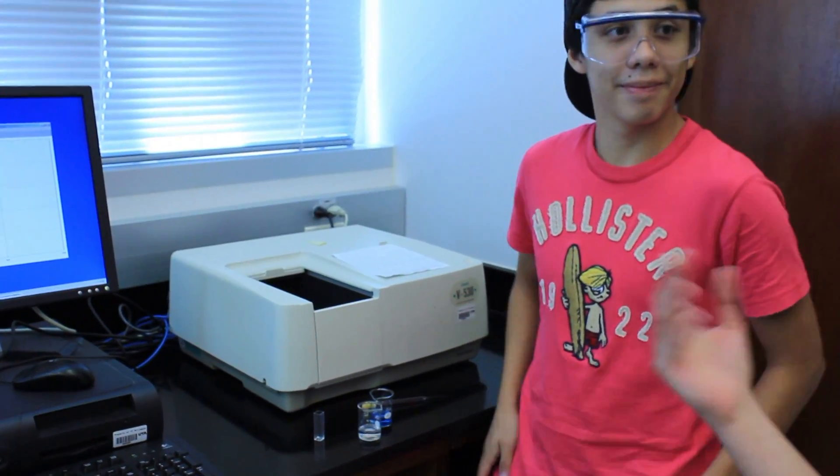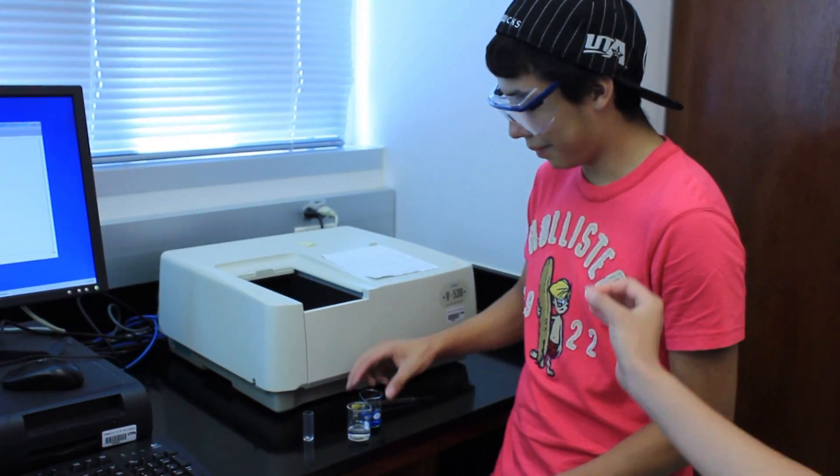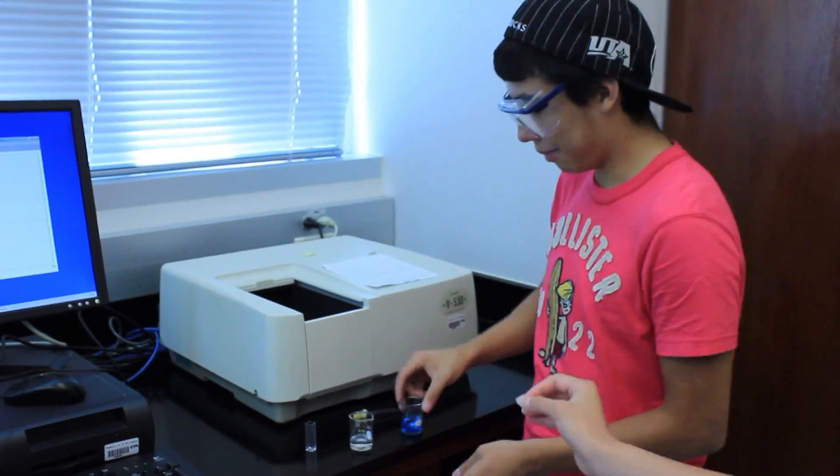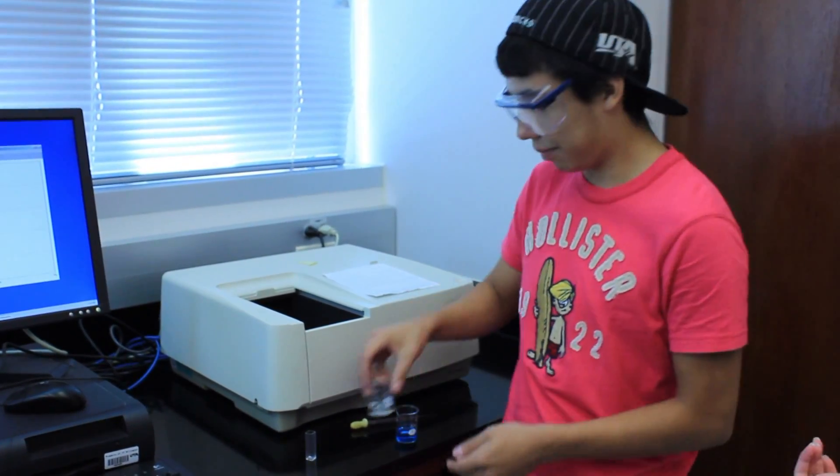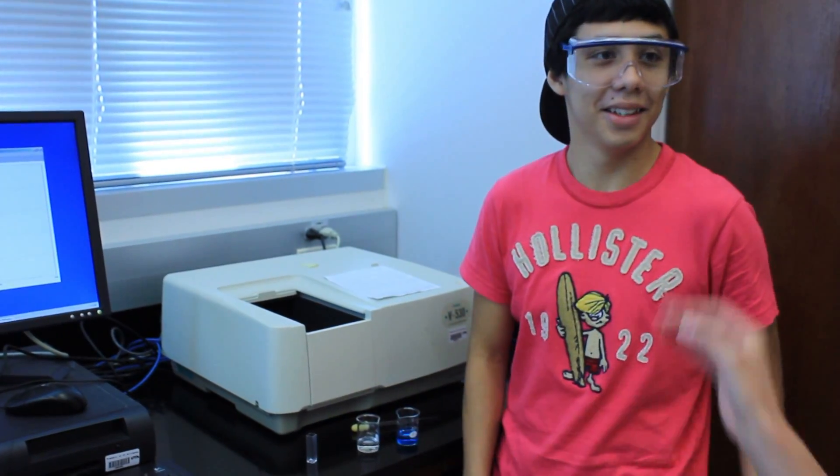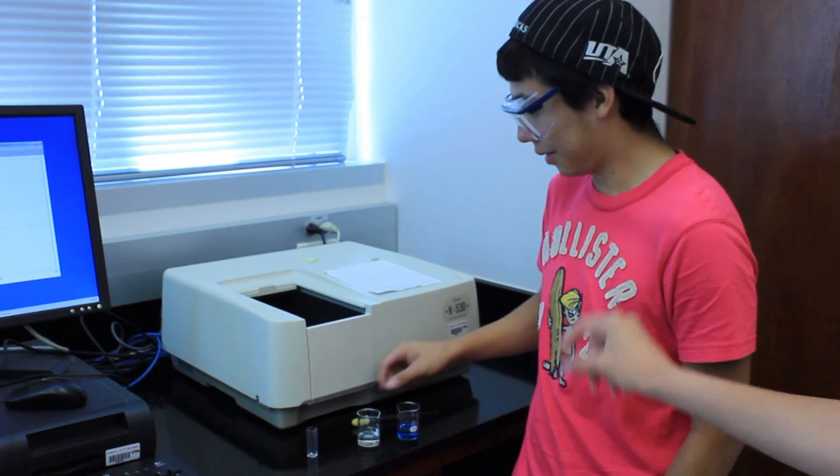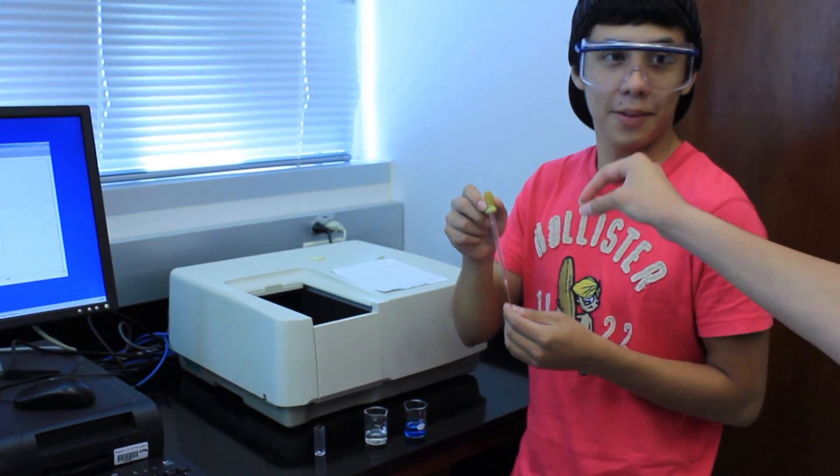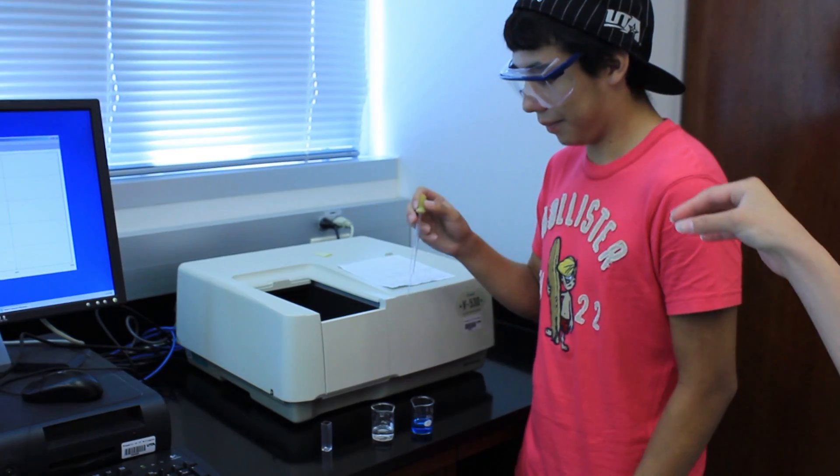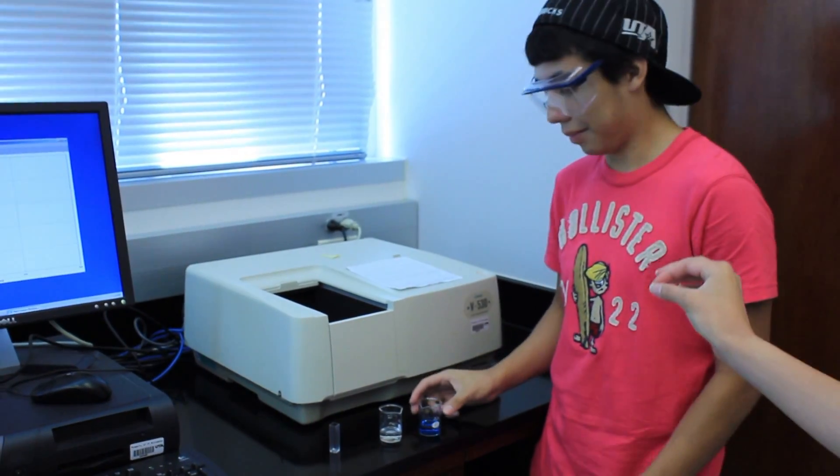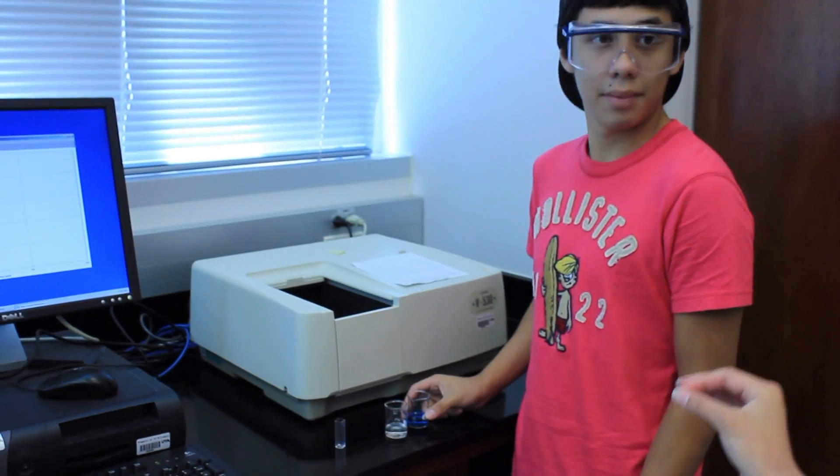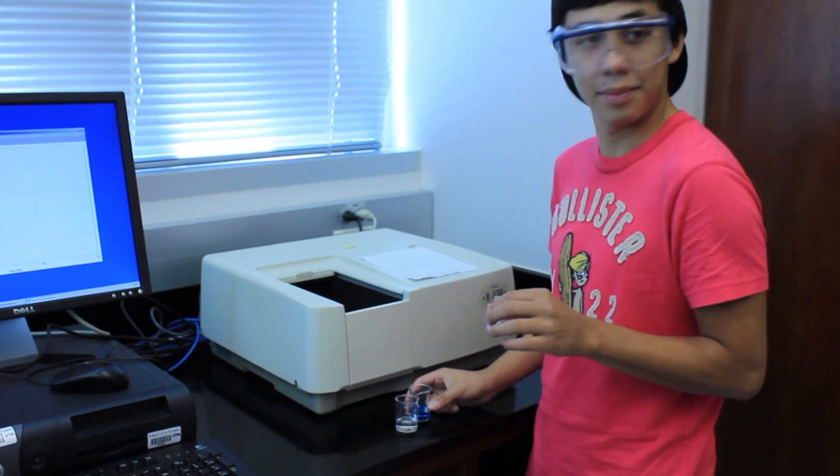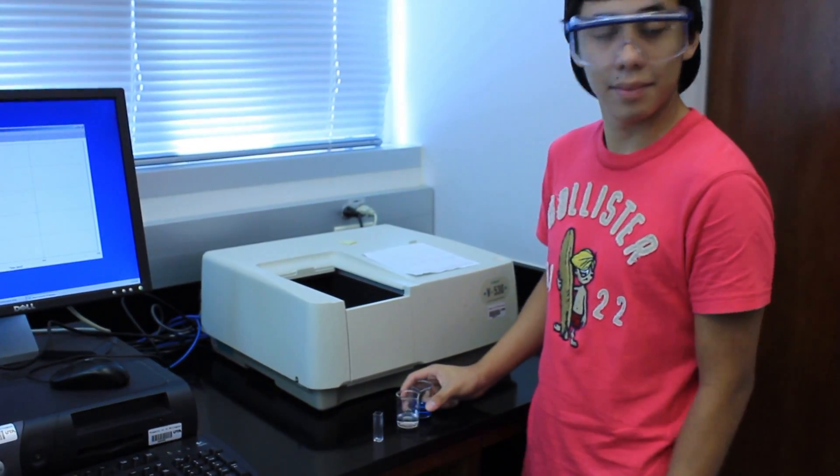Our machine is already prepared but before having done so you should have 10 milliliters of your blue working solution and 10 mils of your bleach working solution ready to go. Now that that's ready and your machine is ready you're going to use a pipette with a bulb on the top. You secure the bulb on the top so that you can collect your liquid and you quickly take some of each blue and bleach and mix them in your cuvette so you can use time course measurement to get your graph.